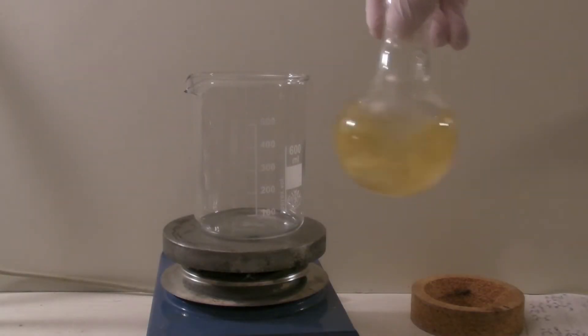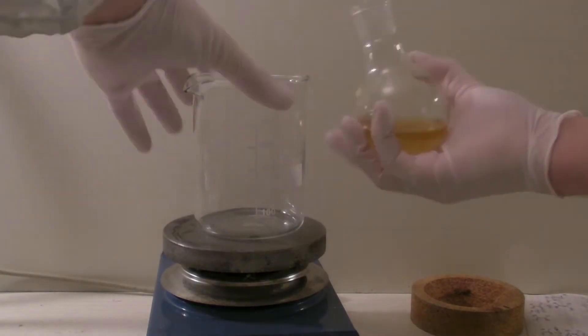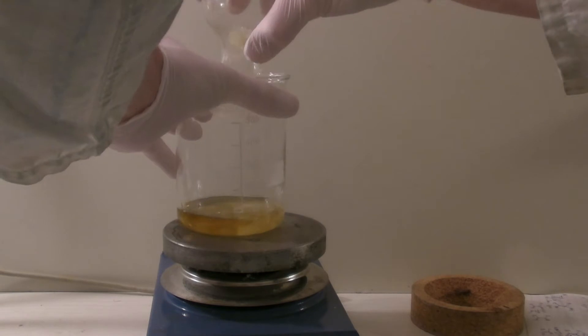The content of the flask was then added to a 600 ml beaker and the residue was washed out with some water.